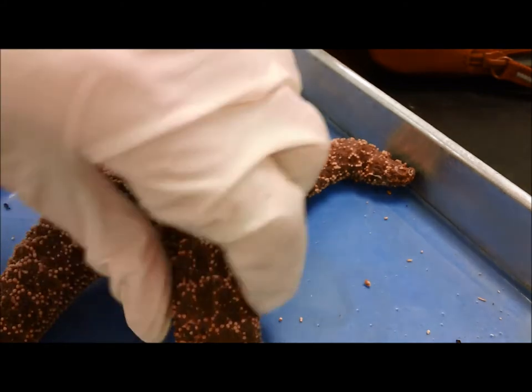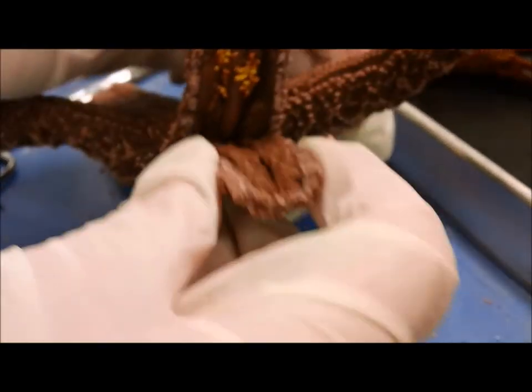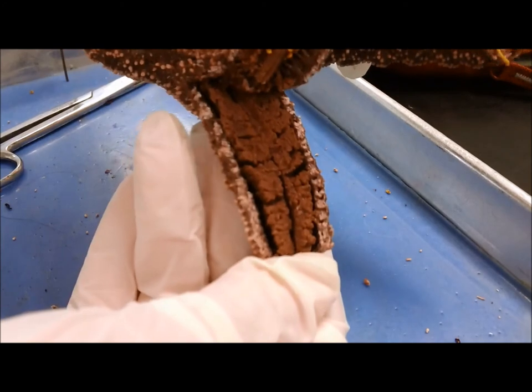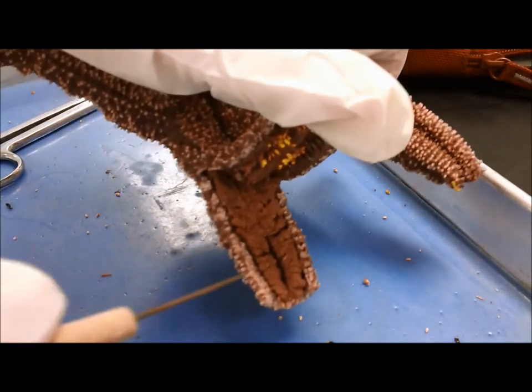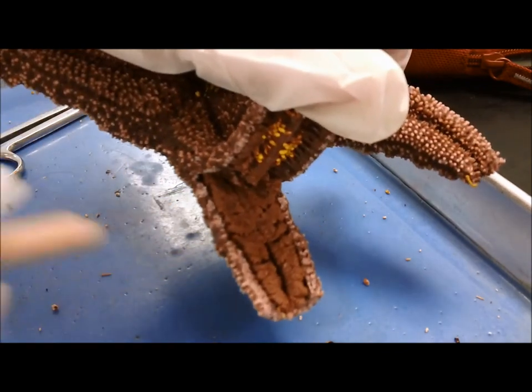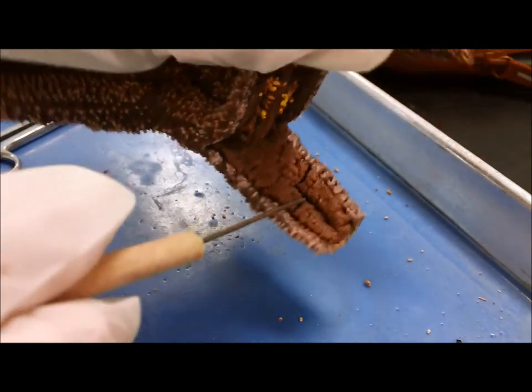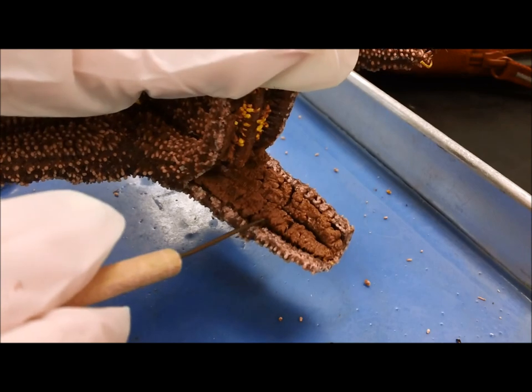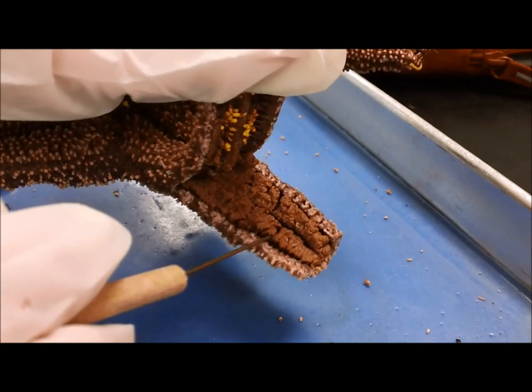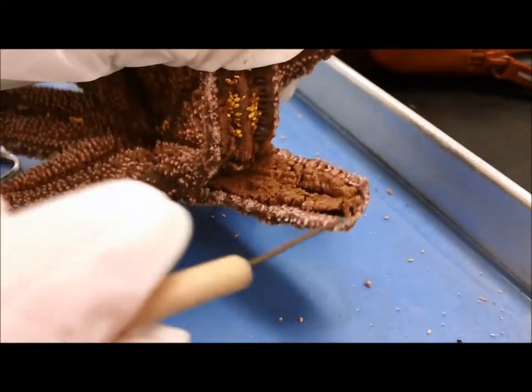So what I should be seeing here is pyloric cecum, and it's actually stuck to the top. Usually it sticks to the bottom, so you can see the pyloric cecum very well there. This middle section of the cecum would run up and attach to the stomach, which is in the central disc. You can see there's basically a whole set of intestines — just a whole bunch of little pouches where it digests its food, running in each of the arms.